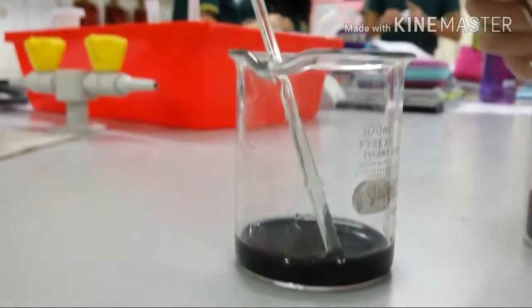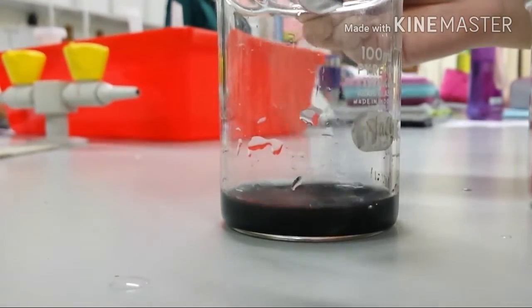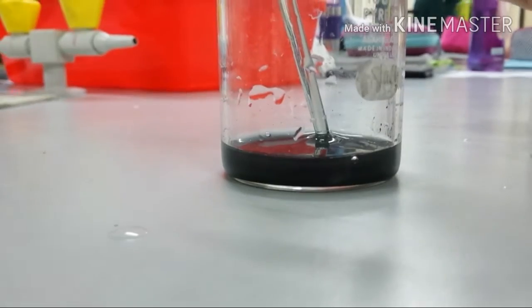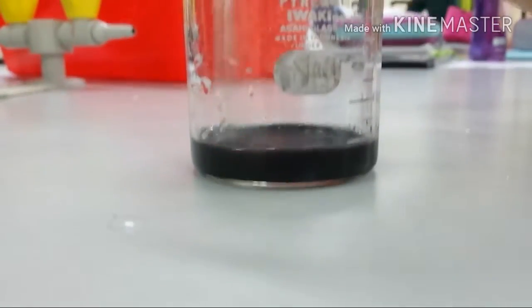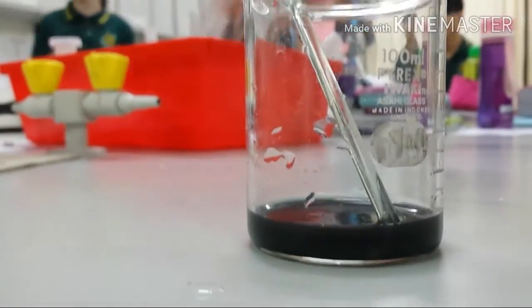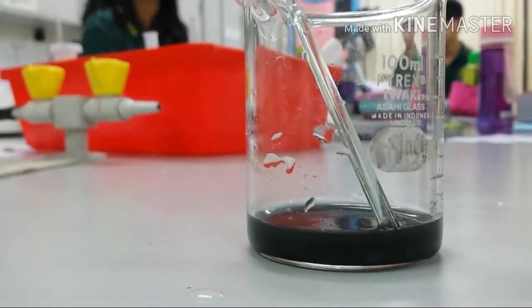Okay, so we're now stirring it around. When do you stop? When there's no more copper oxide. How do you know that? No more fizzing, right? Okay, let's keep doing it. I don't think there's any fizzing anymore. I don't know.